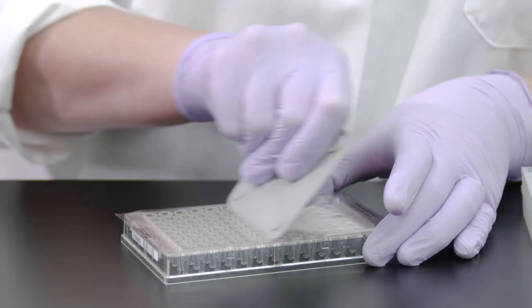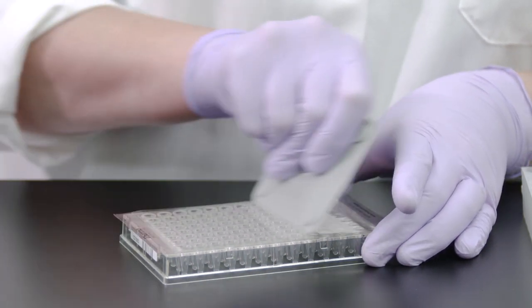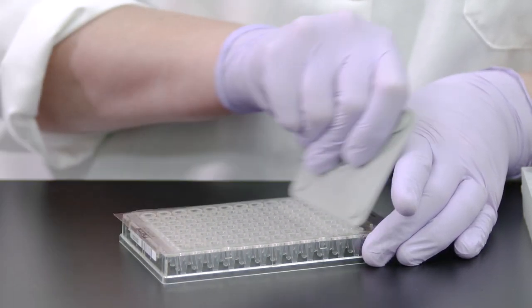Using the adhesive film applicator, press and move the flat edge of the applicator back and forth along the long edge of the plate.